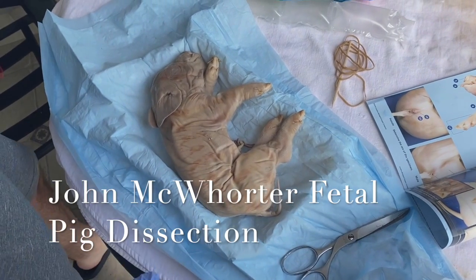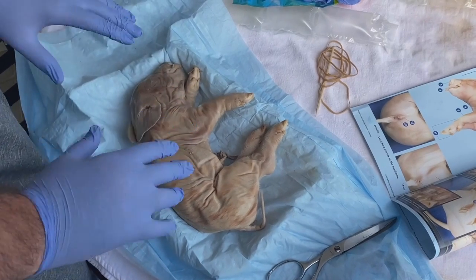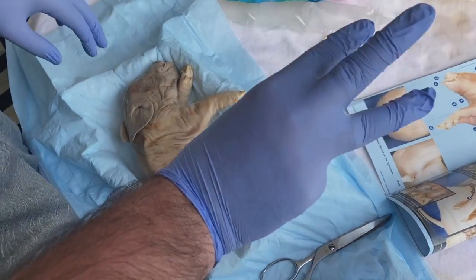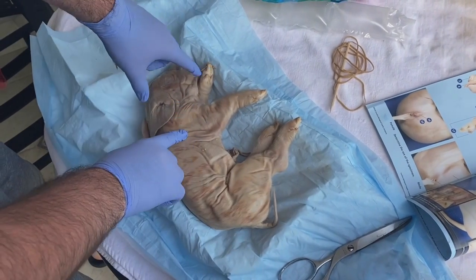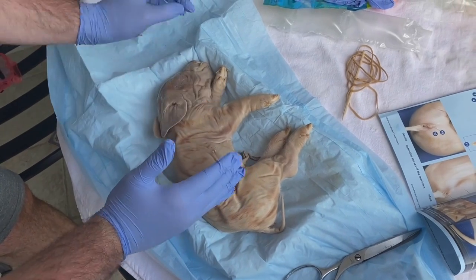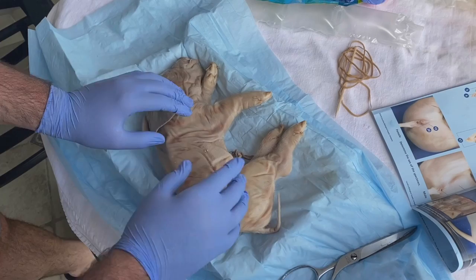So here we have the fetal pig. First we're going to look at the external anatomy. So the body is composed of 3 regions. Number 1 is the head. Number 2, we have the trunk. And then number 3, we have the tail.